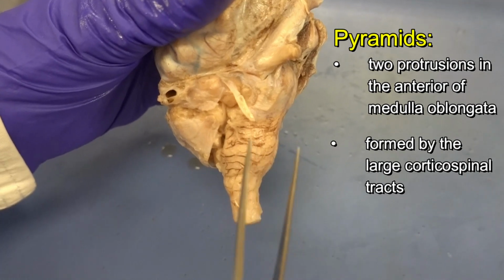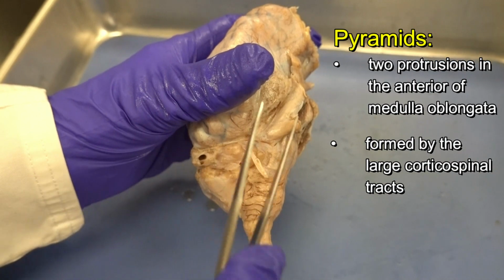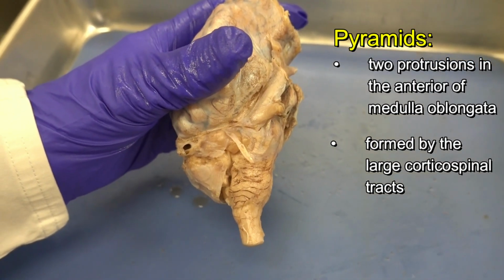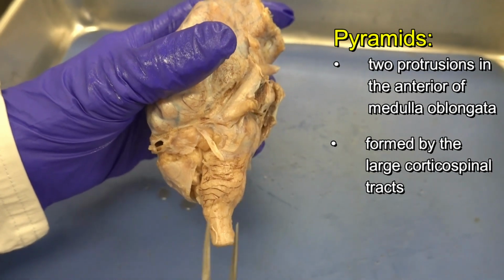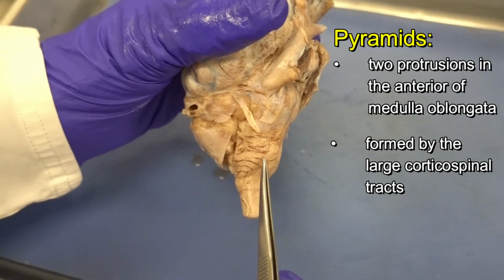Those are the fiber tracts that, from the motor area of the cerebrum, cerebral cortex, transmit signals to the spinal cord to control the voluntary movement of our trunks and limbs. And when corticospinal fiber tracts pass through medulla oblongata, they form the pyramids.